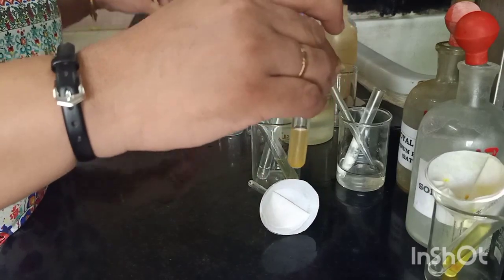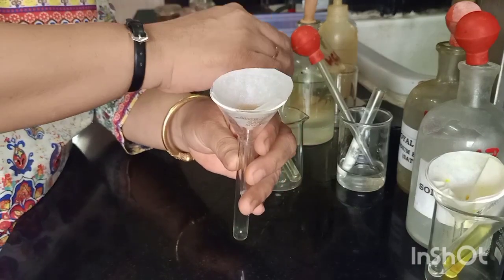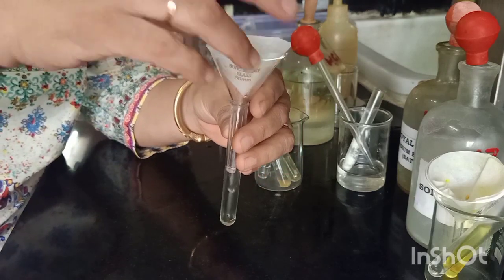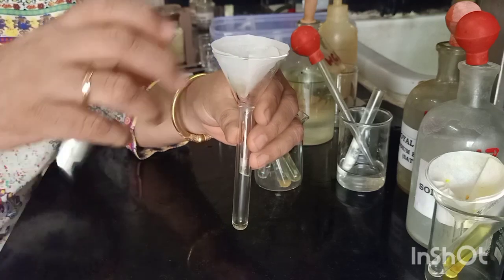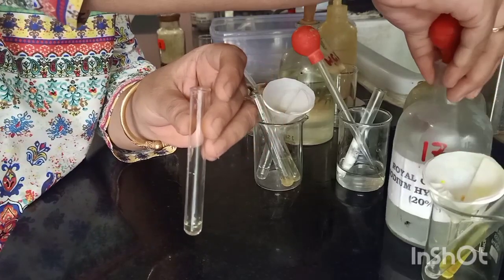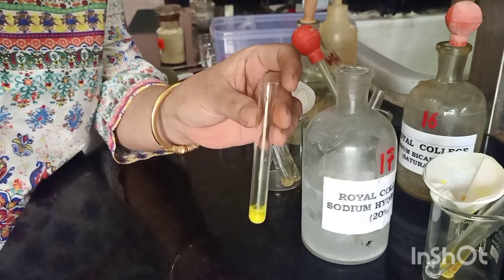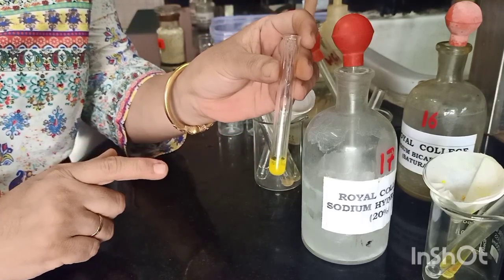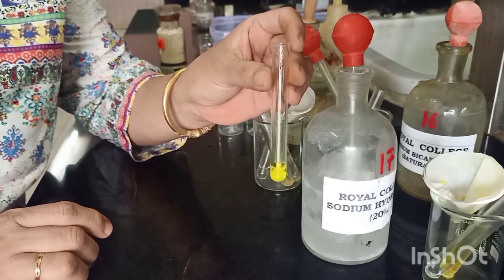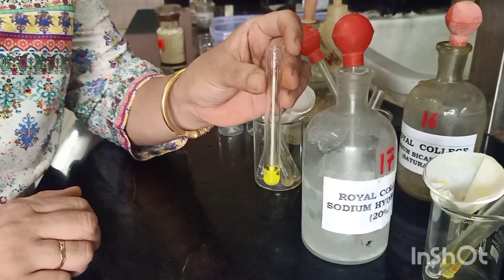The reagent for re-precipitation of a base is sodium hydroxide. So let's use sodium hydroxide to check for re-precipitation. As you can see, we are getting a distinct yellow colored compound indicating the presence of a base. Our component B is therefore a base. So today's mixture type is a water-insoluble acid as component A, detected first in the series of reactions, and a water-insoluble base as component B.